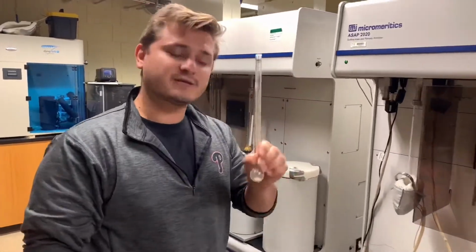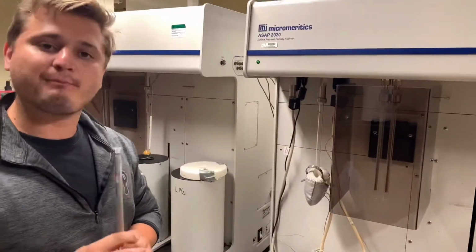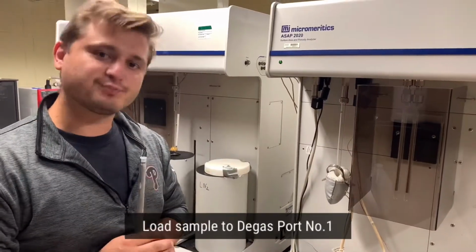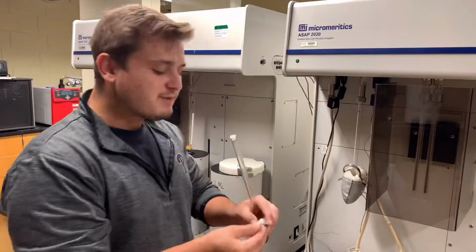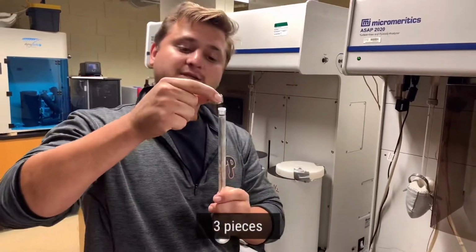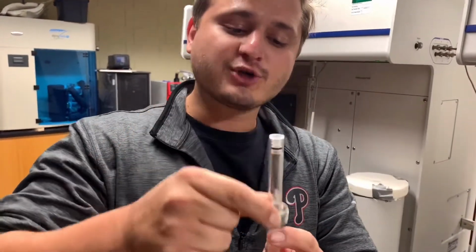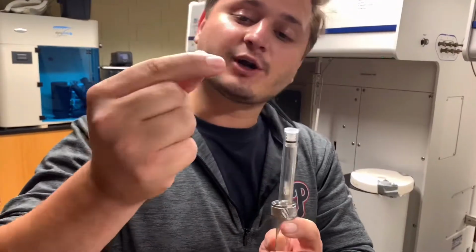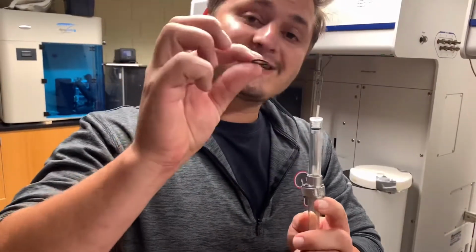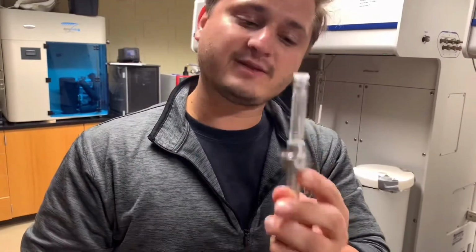What we want to do is load our sample onto degas port number 1, as that is the port that is not being used at the moment. If both ports are being unused, it does not matter which port you use. We have 3 pieces to the connection part of the instrument. We have the first piece, which is the large outer ring, and is what actually screws onto the instrument. That goes on first. Then we have this inner metallic ring. That goes on second. And then we have our plastic or rubber O-ring that then goes on third. And that fits tightly around the sample tube.